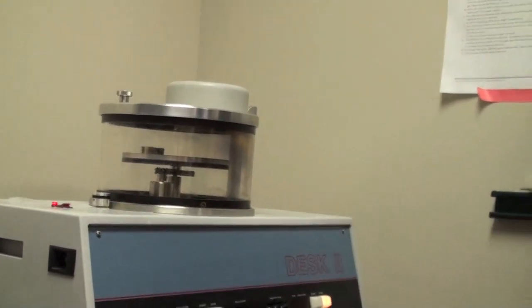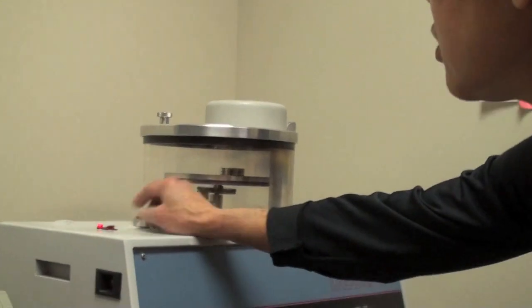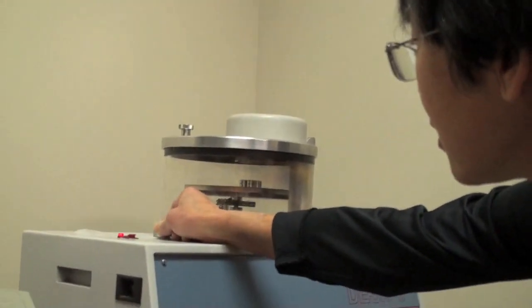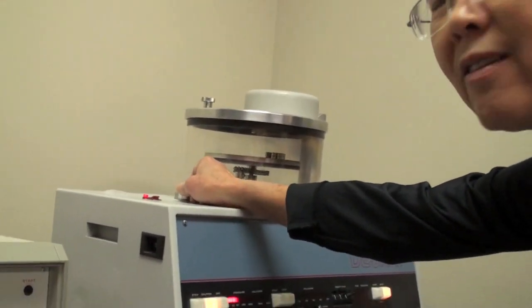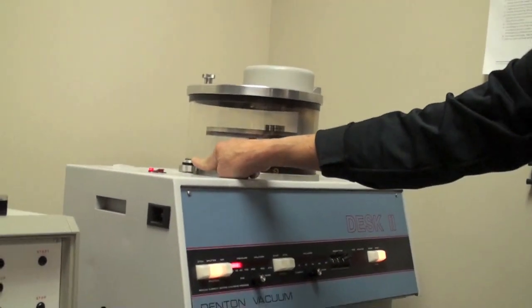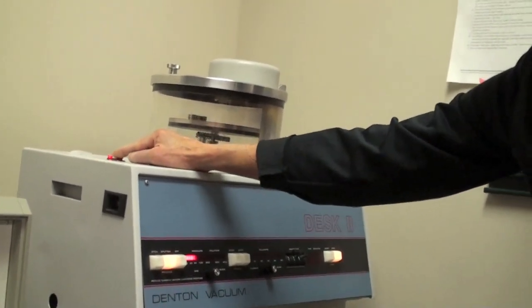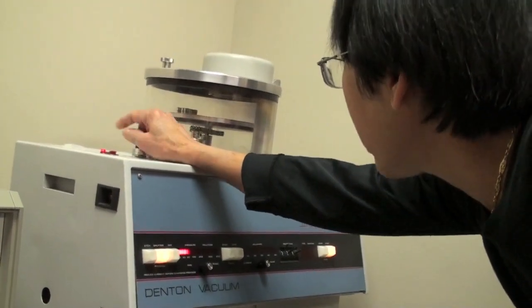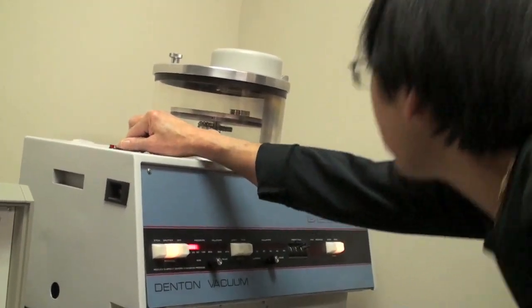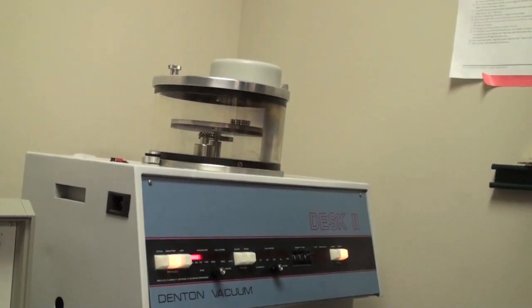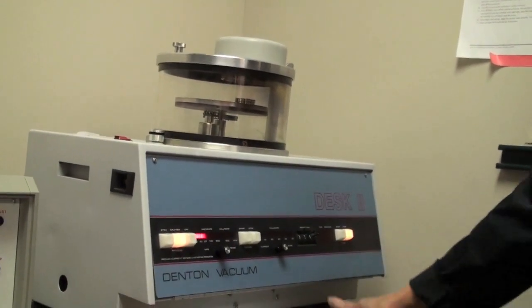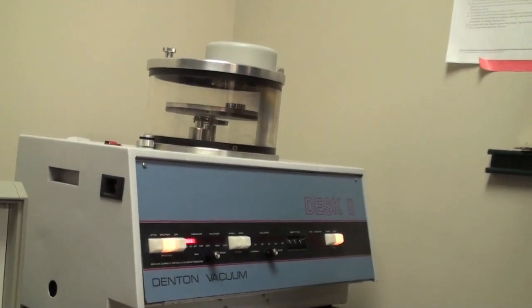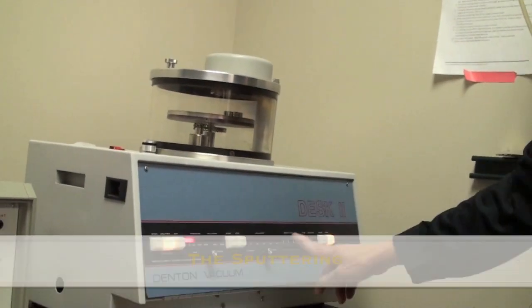You can turn it on, but if you turn the plate, this means you should take longer time because it takes time to come around underneath the argon gas. So the flip, the button up there is turning the plate. And you can adjust this. Adjust the speed. This is only for if you have a sample that's bigger than the gold target.